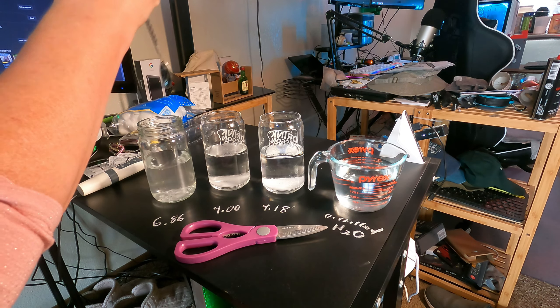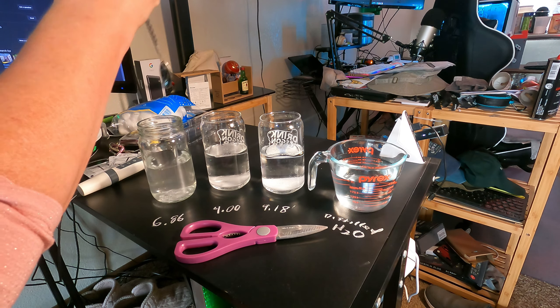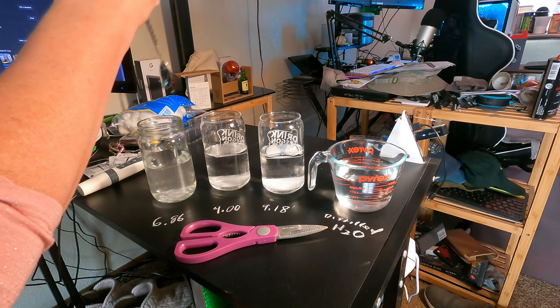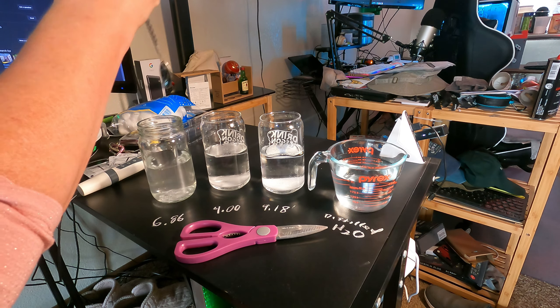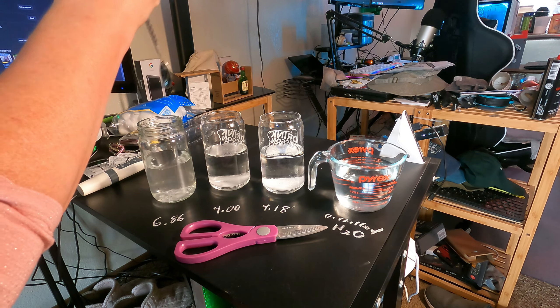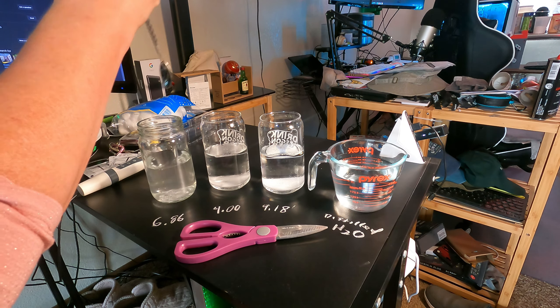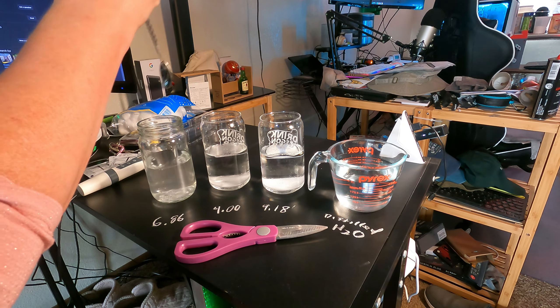One, two, three. That's brighter. Yeah, that is much closer to six. I'm happy with that, and I should probably go get the meter and we can check it that way too.